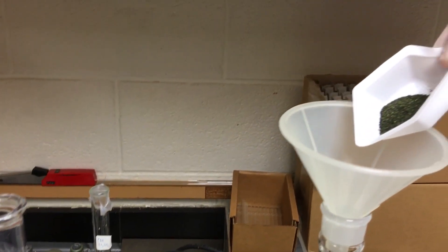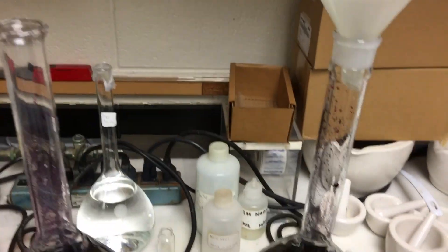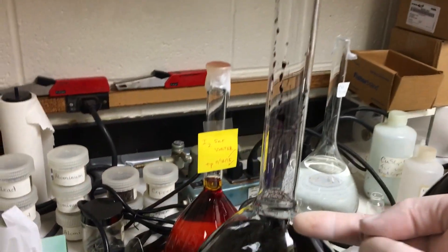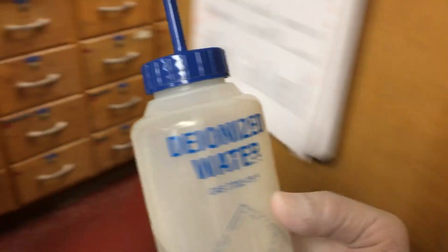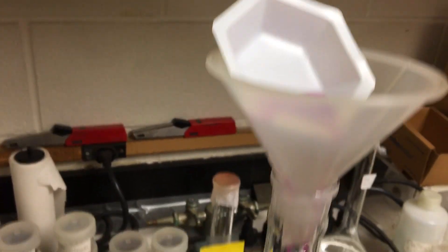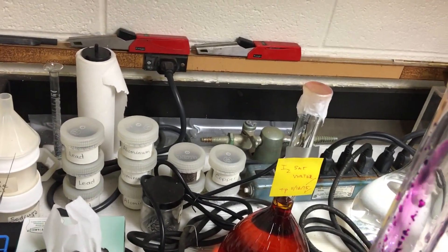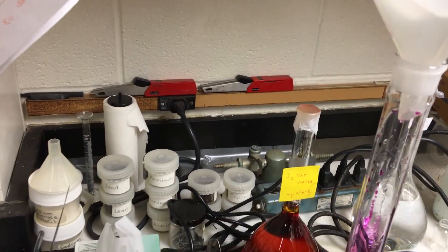See the color? I'm going to rinse out the weigh boat with DI water into the flask — see the color? And then I'm going to use the DI water to rinse out the whole thing and bring it to volume. Let me grab the DI water. Try to get it all in — rinse it out. Do it one more time. Okay, that's good.